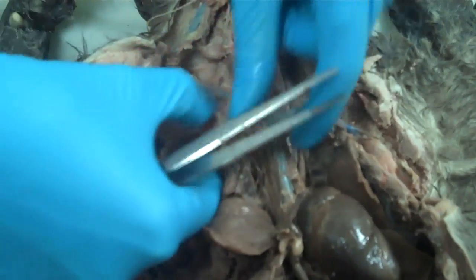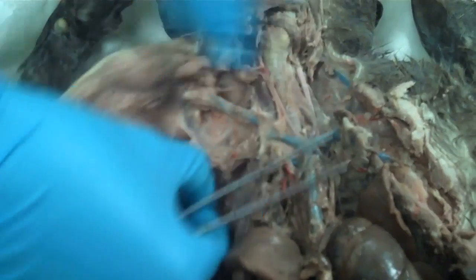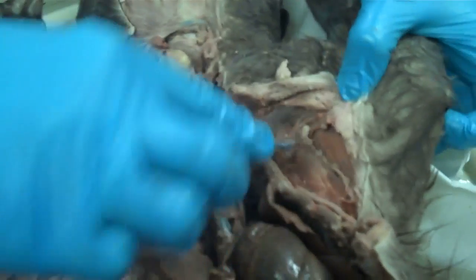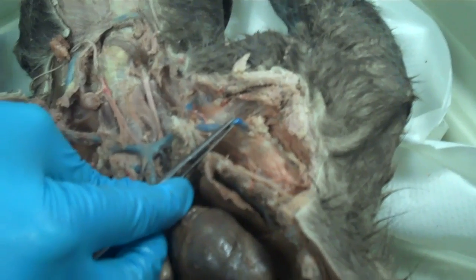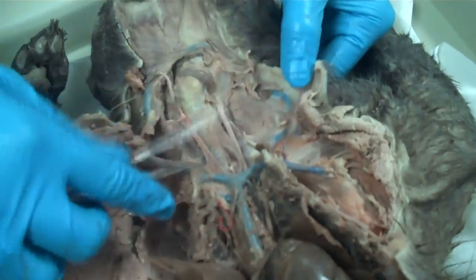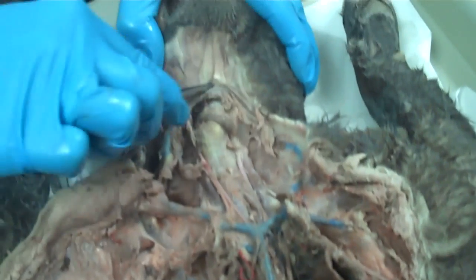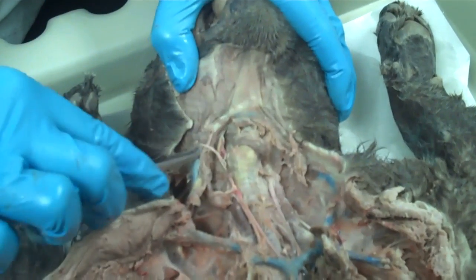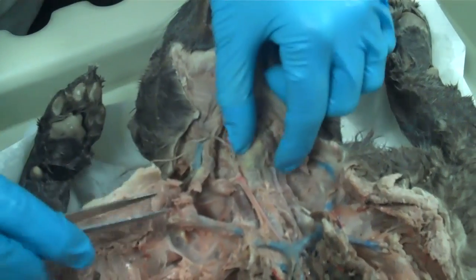The brachiocephalic then branches again, becoming the external jugular which goes towards the head. Over on this side you can see it better — there's the one going towards the arm, which is the subclavian. Sometimes you can see the internal jugular, but on this cat I don't see it. What's interesting is if you clear the top, these two external jugulars kind of go in a loop around.